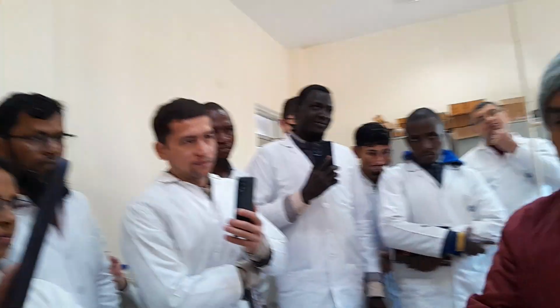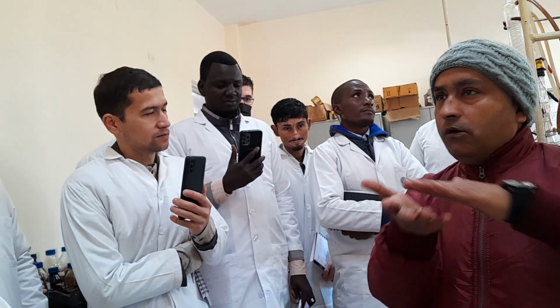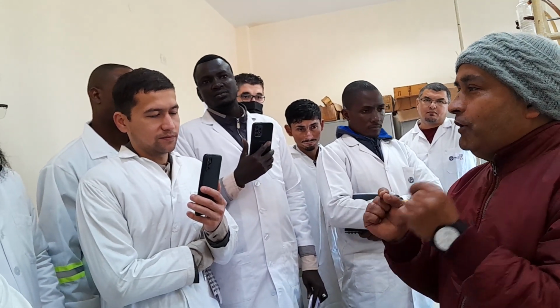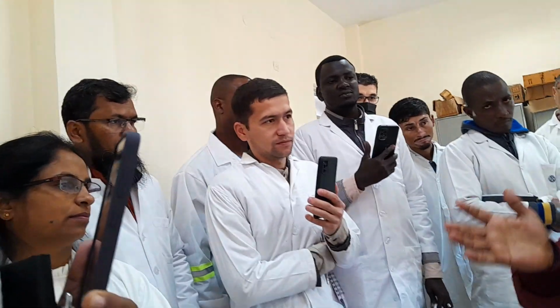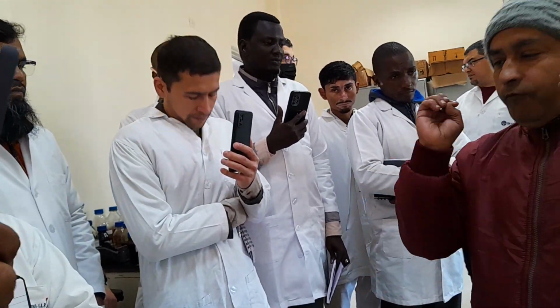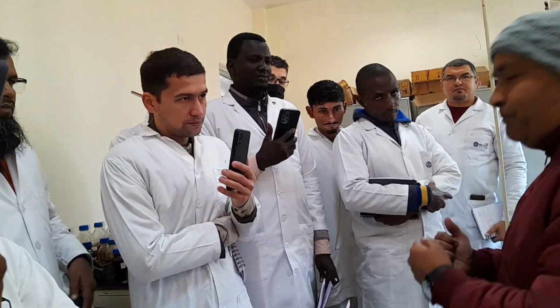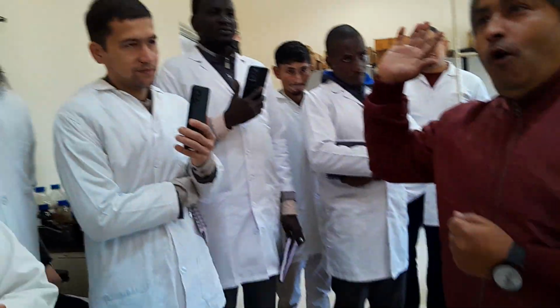Once you have completed the distillation, initially you get the LPG potential. That report you get by GC, the whole composition. But the naphtha is from C5 to 140 degrees centigrade. If I do anything wrong during the distillation process, the naphtha collected by fractional distillation has to be passed through the whole physico-chemical characterization. For example, if I want to skip the distillation, I will finish at 5:30 and go home and rest.